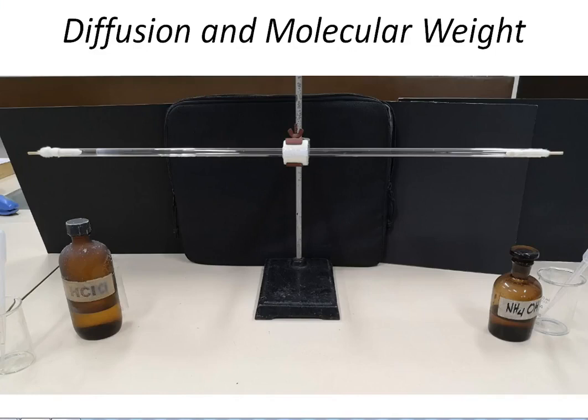Now, after a few minutes of waiting, we are able to observe the formation of the white ring precipitate. Can you see it on the screen? Can you see the white precipitate?